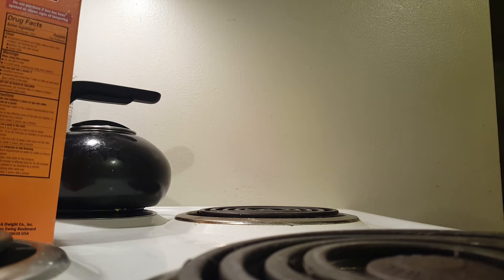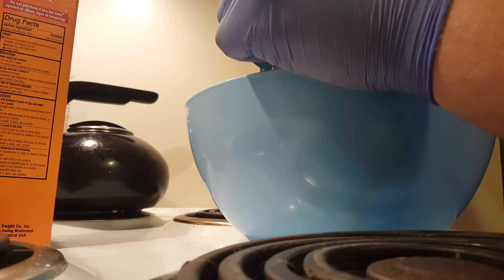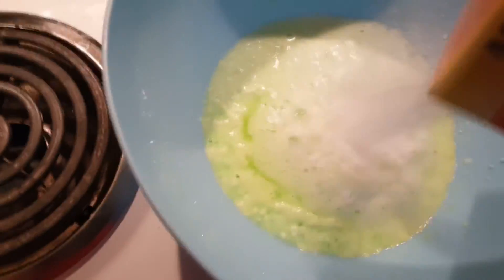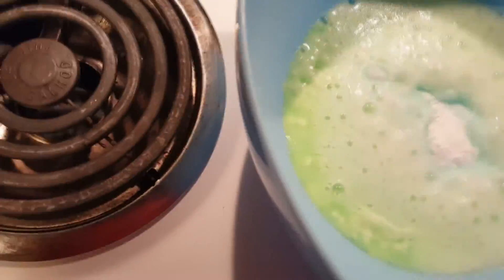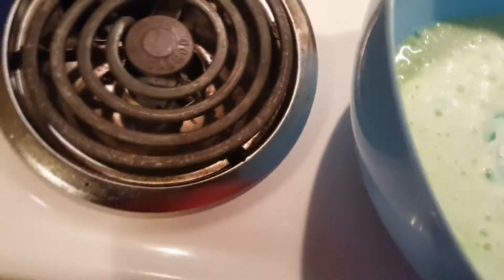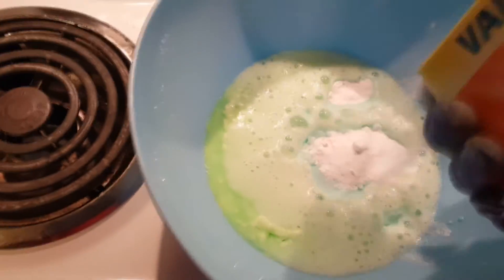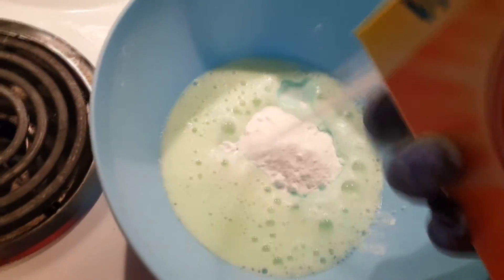The observant of you may have seen that while I was stirring the solution in the mason jar, I had a small green layer at the bottom of the jar that when I stirred the reaction, disappeared almost entirely all at once. That was because the sodium bicarb actually created a physical barrier so that it could only react with a small amount of HCl. So to fix this problem I stirred it, but because I stirred it, it started to bubble and hiss and foam really rapidly and actually got out of control at one point.